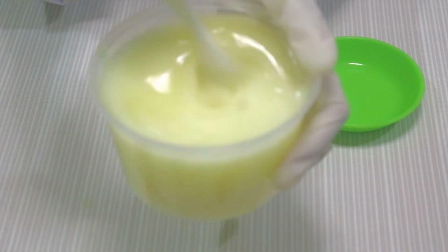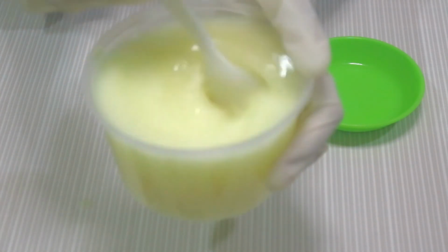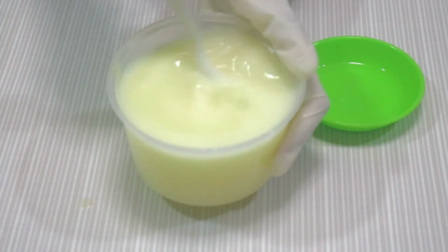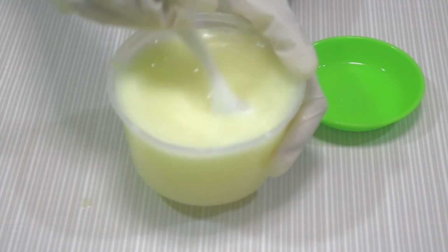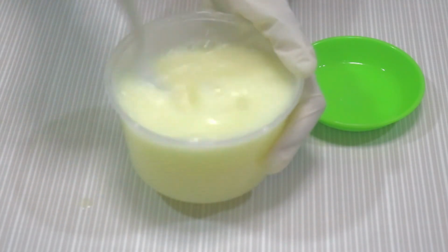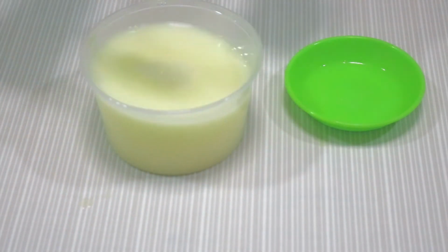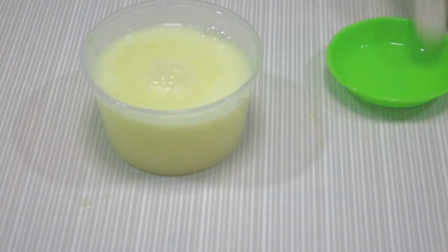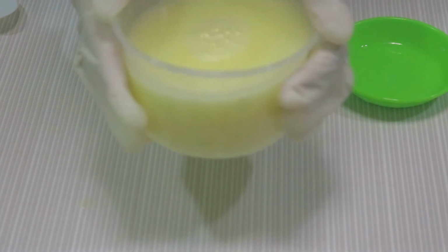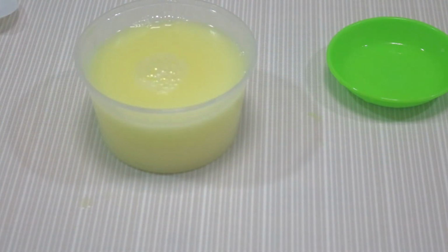Just stir as fast as you can, and then it becomes mixed together, because when you add oil to water, they don't mix with each other, but when you add soap, they can blend together. This is due to the role of soap as an emulsifier. When you put the soap in the water that is mixed with oil, it will bind to the water and dissolve it, and then it can help the process of oil dispersion in the water.